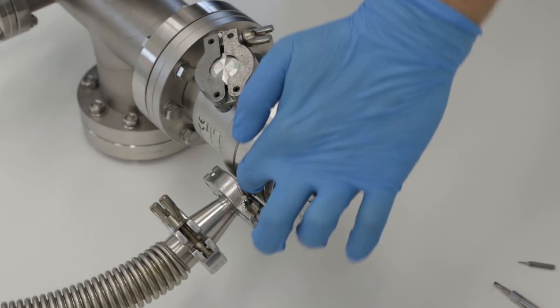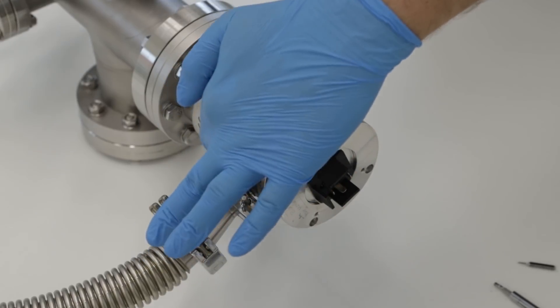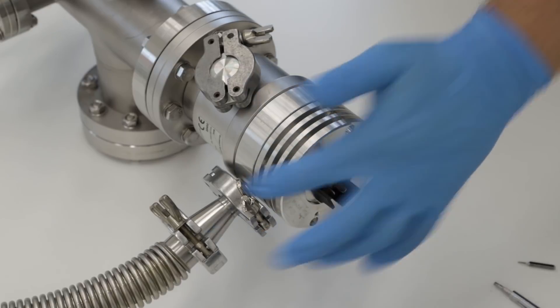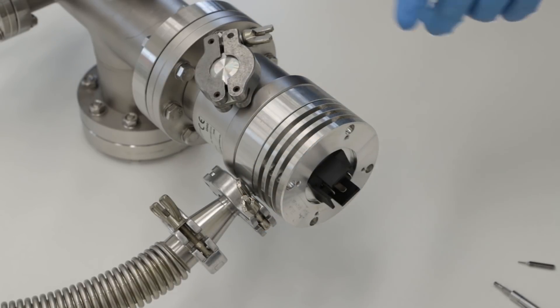Okay, looks like it's here. It's not this o-ring but the o-ring which is here, because the signal is stronger on this place than here. So we'll try to replace another o-ring.